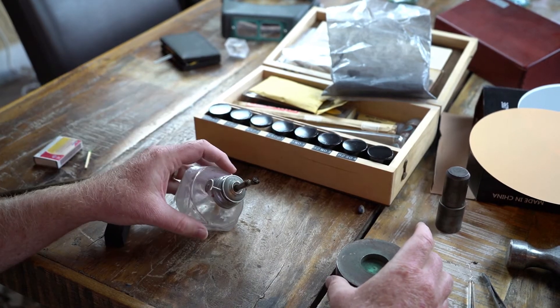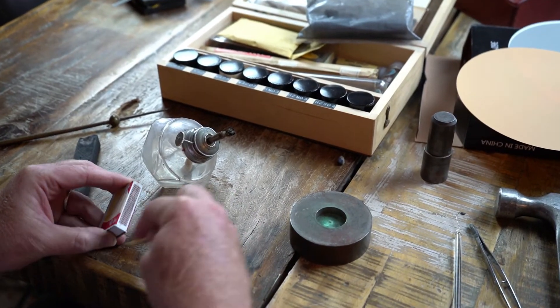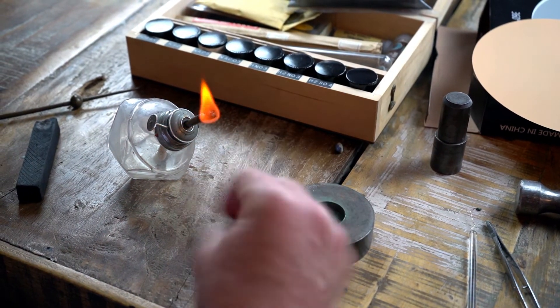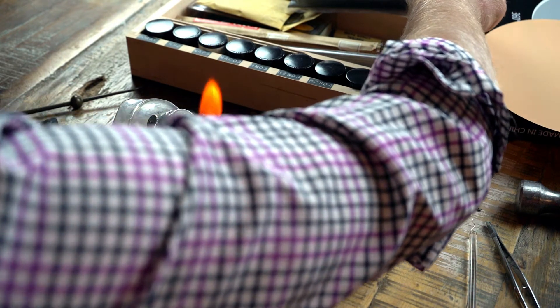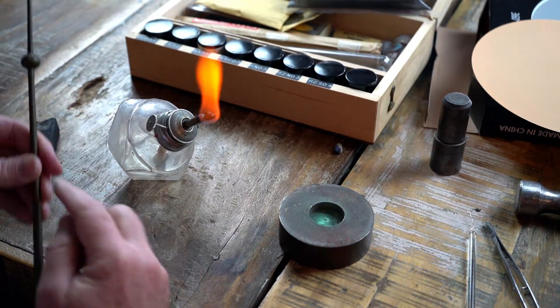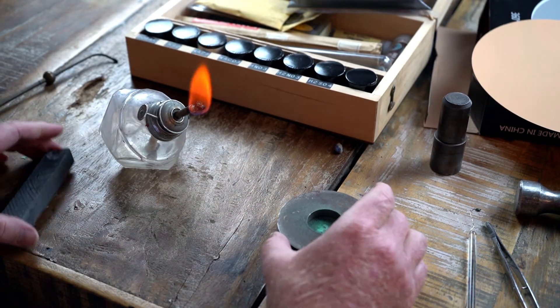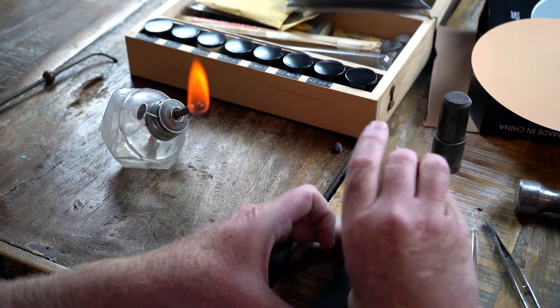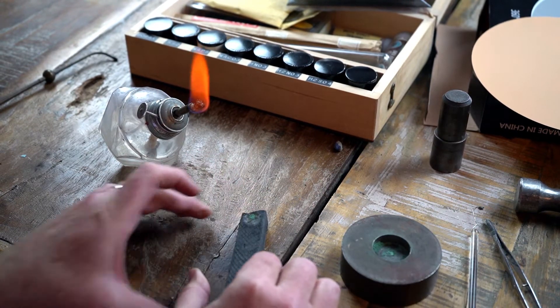There are a number of different tests. I'm just going to do an open test real quick and we'll see if we can make this work. That is just a denatured alcohol in a lamp. And this is called a blowpipe. This is used for blowing a stream of air through here to turn this into a little bit better of a torch. So we're going to take some of this powder and put it on the charcoal block here — just a little bit on there.